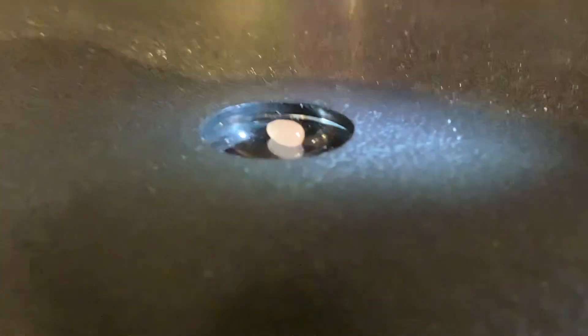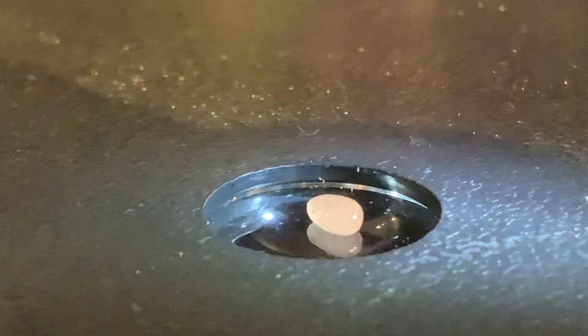Attempt six! Anyway, this is the little microscope thing. Now see this little tiny piece of putty? That's what I'm zooming in on. Just gonna move this rock everywhere.